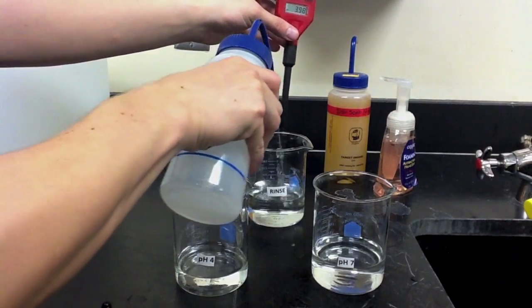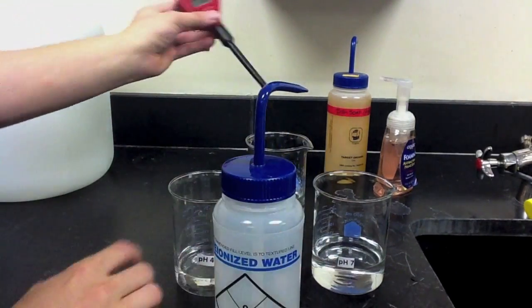Just to ensure there's no residual buffer on it though, we will rinse one more time before we use it.